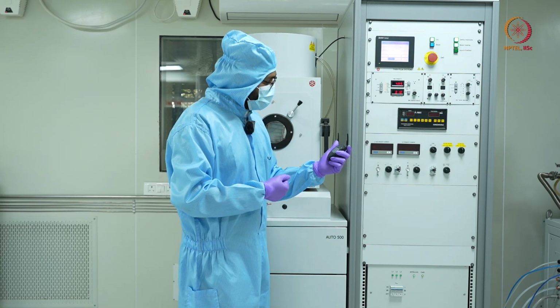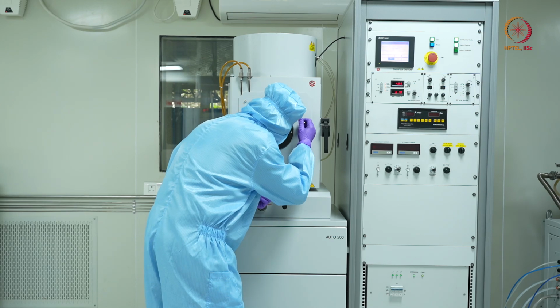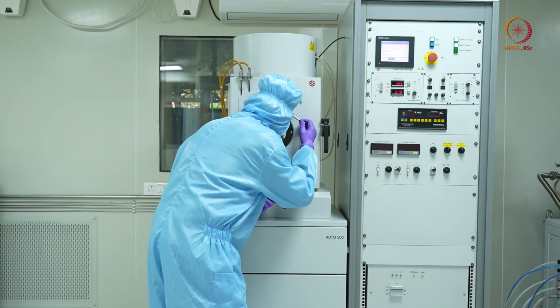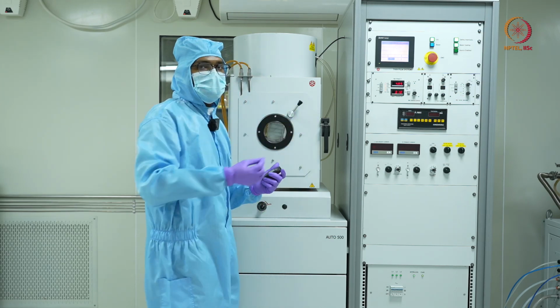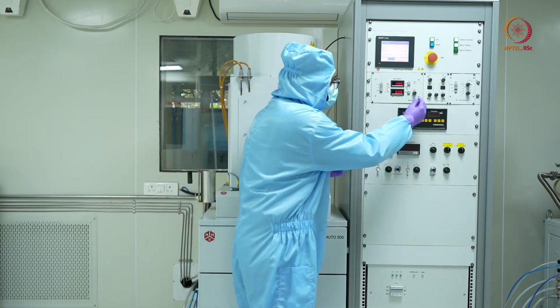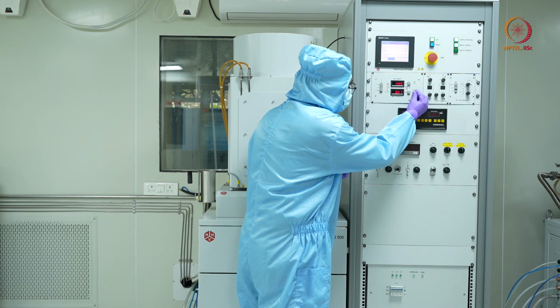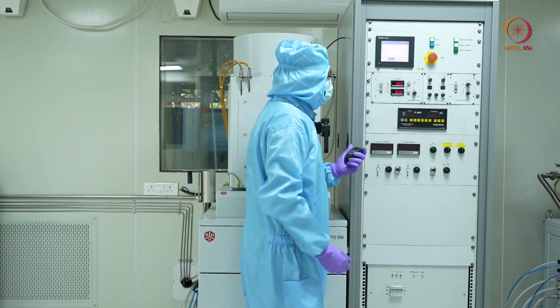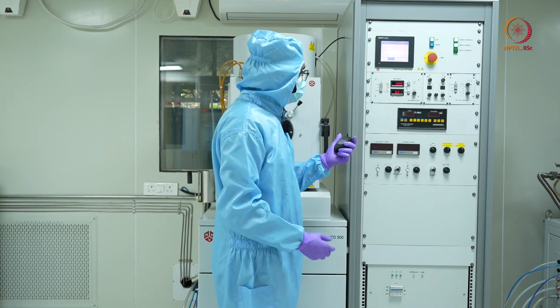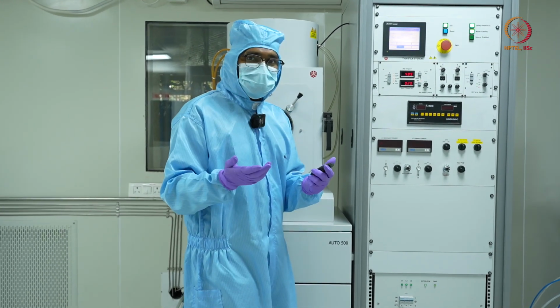We are almost there, and I can also see that there is some glow because of the electron beam, some yellowish glow, which we will show you. Now since the 30 seconds are done, I'll increase it to 20 milliamps approximately, and once 30 seconds are over, I'll increase it to 30 milliamps.